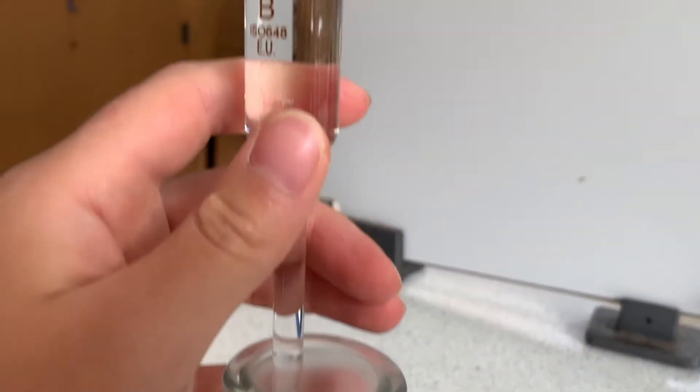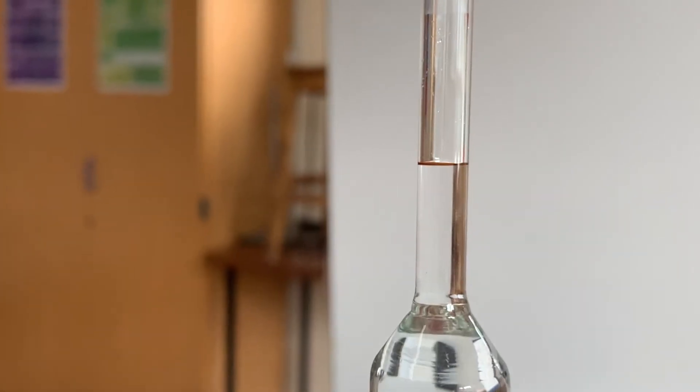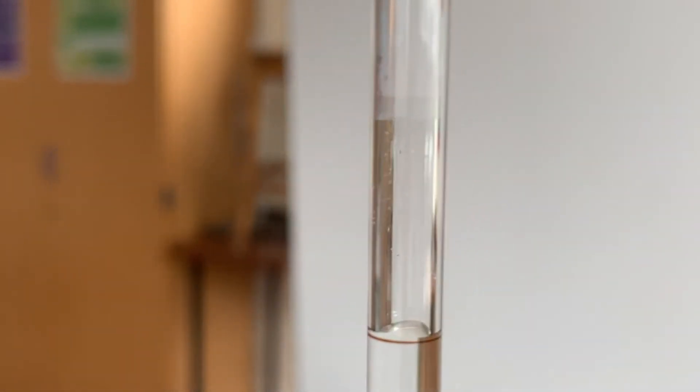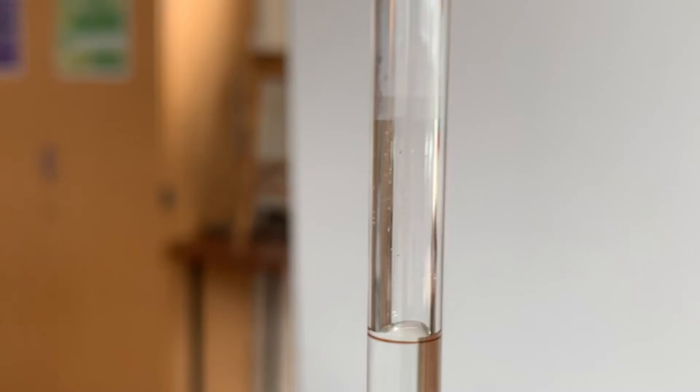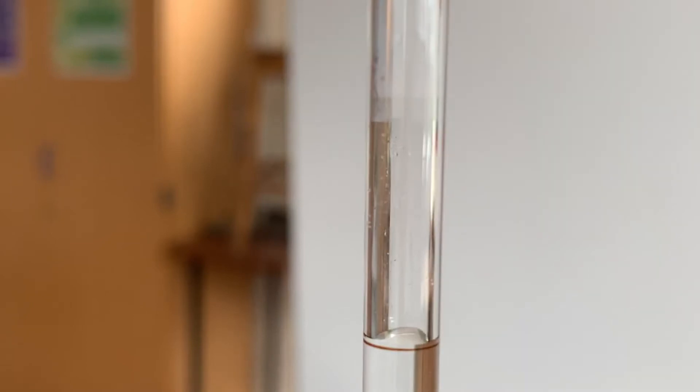As you can see the solution is exactly on the line. You have to make sure you get your eyes level with this line to see it accurately. If you look from above it's going to look too full, so you'll more than likely have to bend down slightly to get your eyes level with the line to see when you've filled the pipette to the right volume.